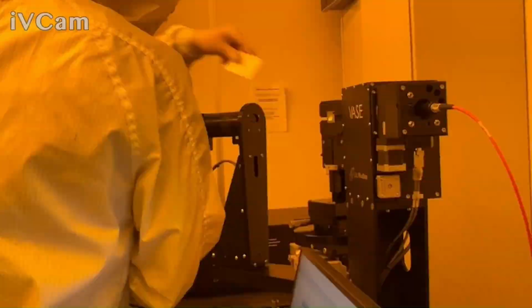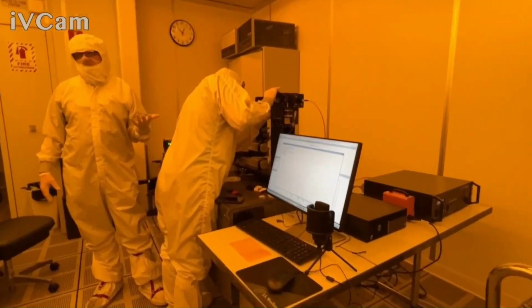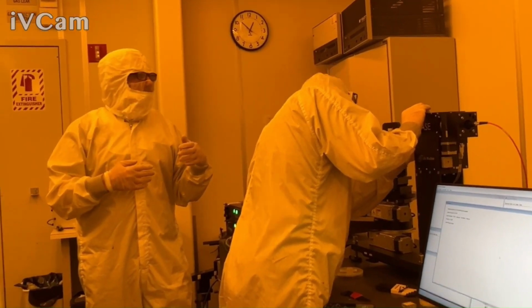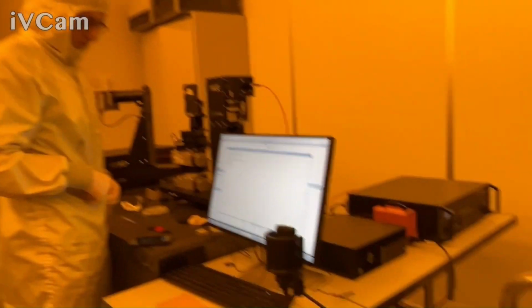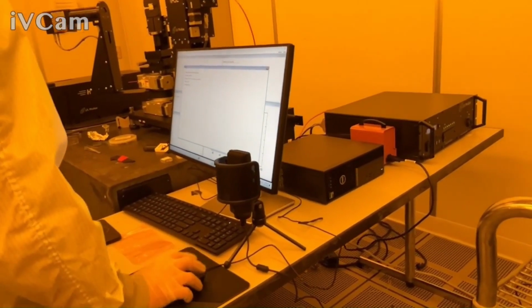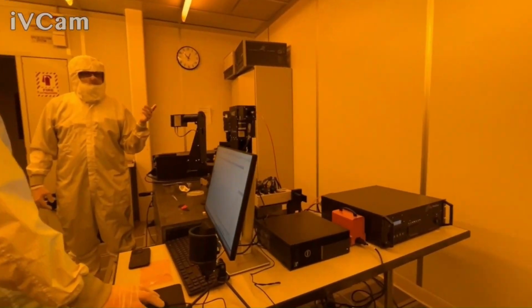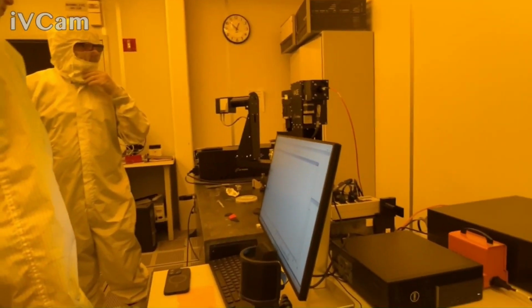Let's go ahead and put the quad in for two reasons at this point, because we're doing just intensity based. It'll be a little less light, but as long as there's some light, that's less of an issue. It should work out well, and we have a better chance of collecting the beam versus angle. So we still want to align the sample though. Well, let me take that back. Let me think about this. Sorry, since we need to do the baseline, we're going to have to do an air measurement first. Now for the air measurement, we'll have to actually pull that off for this.